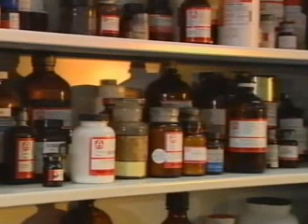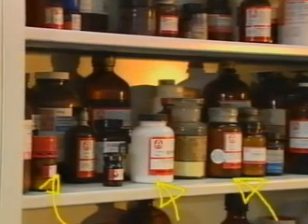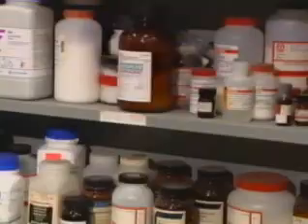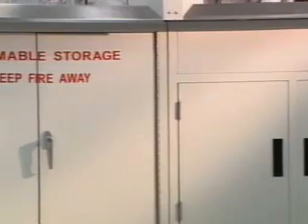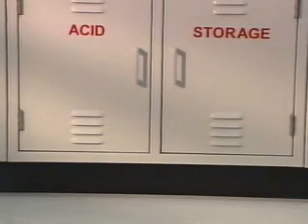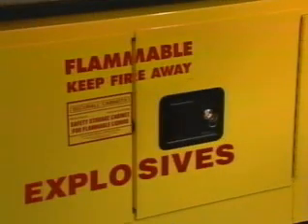Look at those chemicals. They're stored perfectly. Look at how well they're labeled. Well, the storage areas seem to be cool and dry, and they've stored the acids separately from the flammable chemicals. The acids are stored close to the floor to prevent them from falling, and the explosives... Whoa! You really want to keep an eye on them. You bet. The explosives are stored in their own separate storage bin.